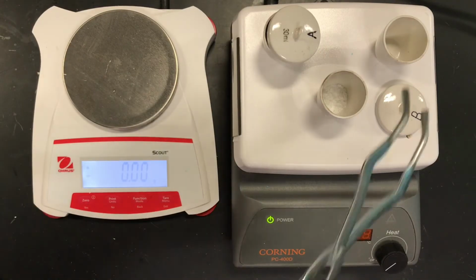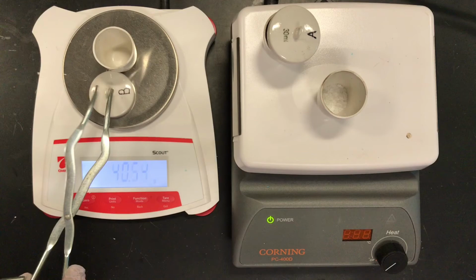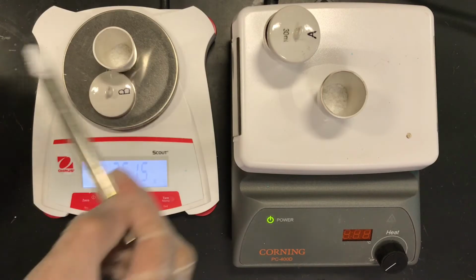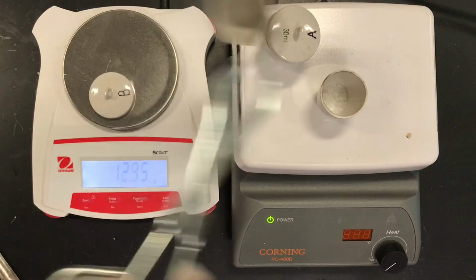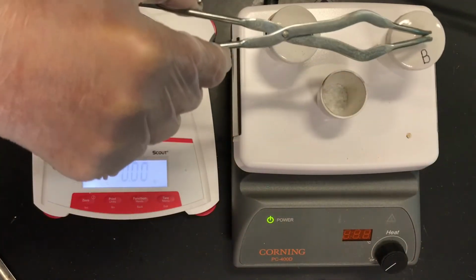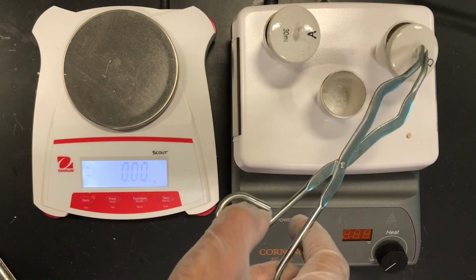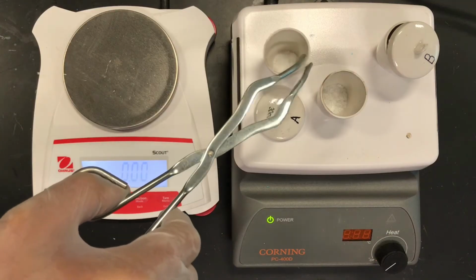I'm putting the cover slightly ajar so the water leaves, but enough of the cover on so that splattering is minimized. Okay, and same thing here. We're going to add some hydrate, and that changes the mass. And student A and B's hydrate values will be different, and that's the reason for having two samples if you're using a virtual lab. Okay. Make sure you pick what sample you're using, B or A, and I'll just, because I am a little bit OCD here with these videos, we'll do that. Okay. And of course, we're going to slightly take the top off there, move this back a little bit. Yes, I'm being a little crazy, but I'm tall.